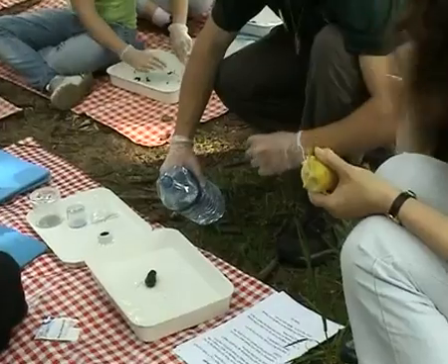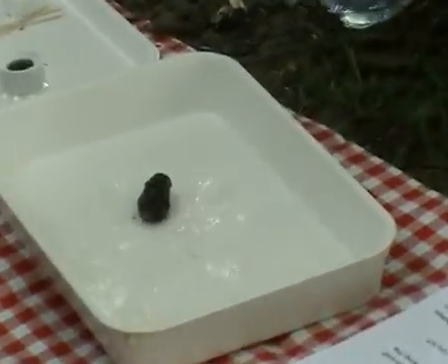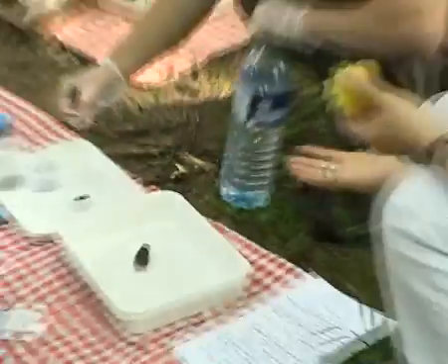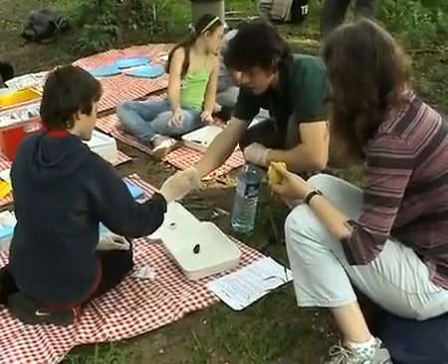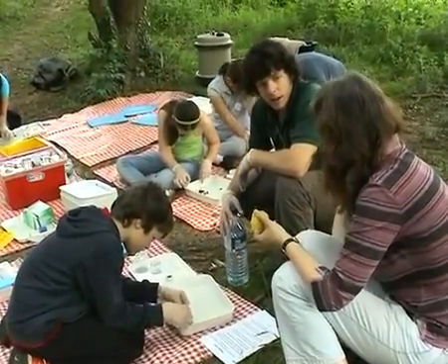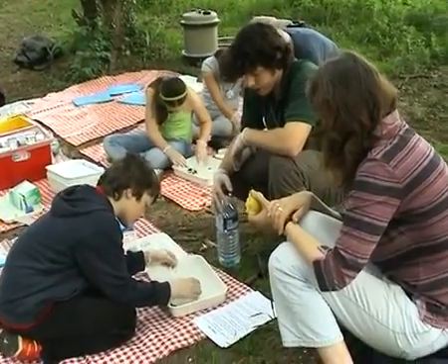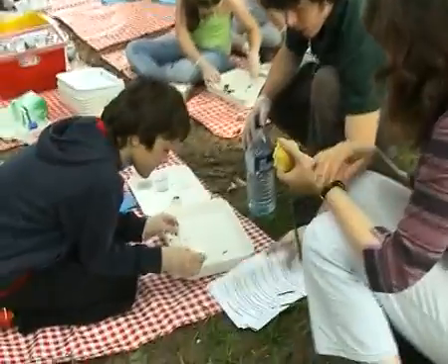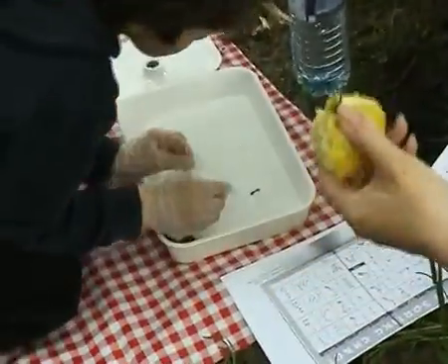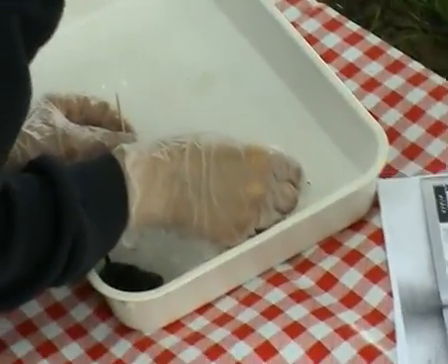That's the most popular answer when people don't know what it is. I think it's most predatory birds as well. And here we've also got loads of guides that will show you how you can possibly find out what animal it is — there are sorting pots, magnifying glasses, and things like that.